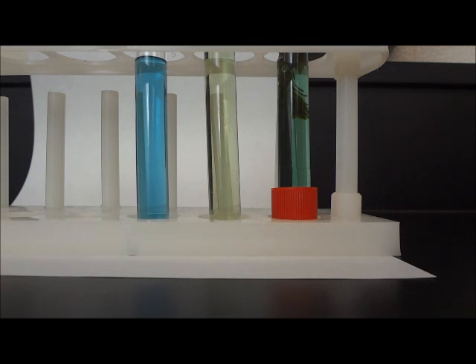Note that test tube 1, which was our control, is still the blue that it started as. Also notice that our second control, the one that was carbon dioxide rich, is still the greenish yellow that it was when it started. But if you look at the test tube with the Elodea in it, we can see that there has been a color change. We added Elodea to the test tube with the carbon dioxide rich solution. After 24 hours, the solution has started to turn back to green.